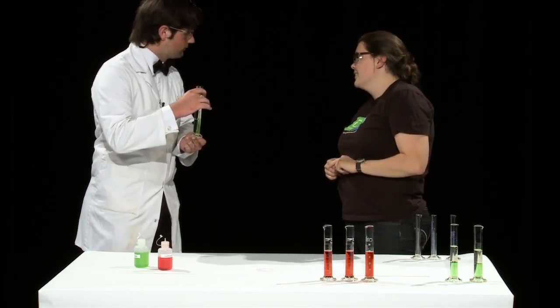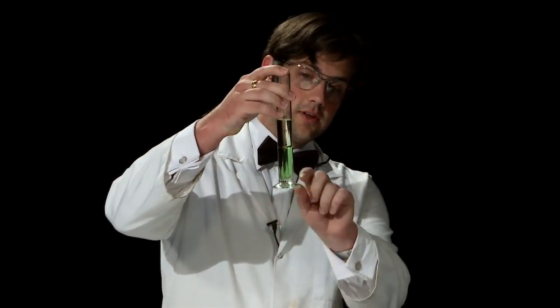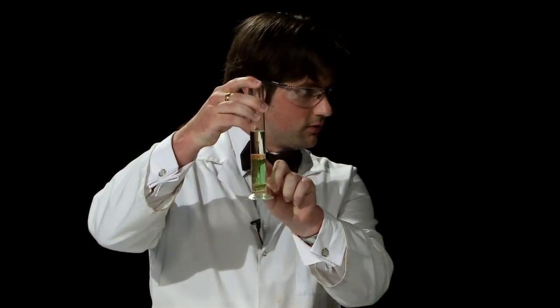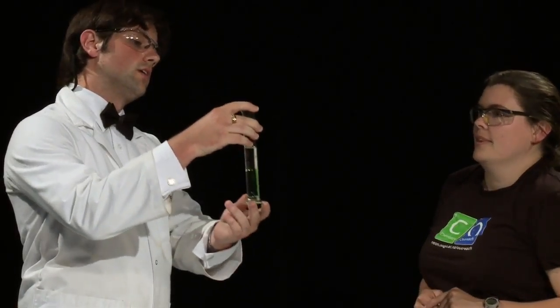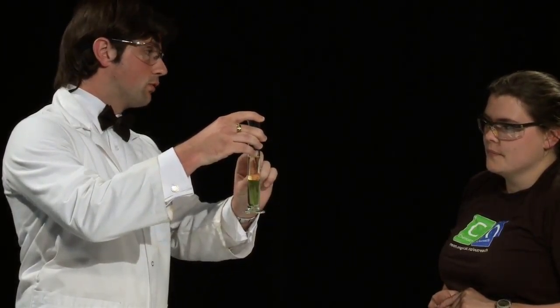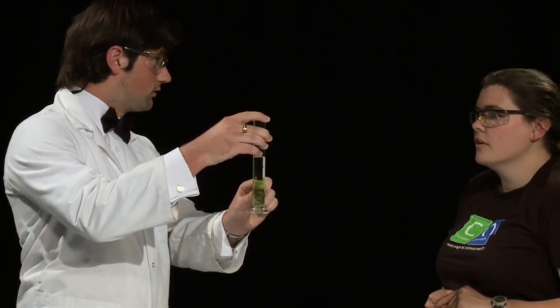Now pay attention. As you can see the water and the oil have not mixed. Now remember that particle diagram from the start of the class? That showed that there are gaps between the water molecules. But the oil can't mix with the water so it doesn't get filled up.